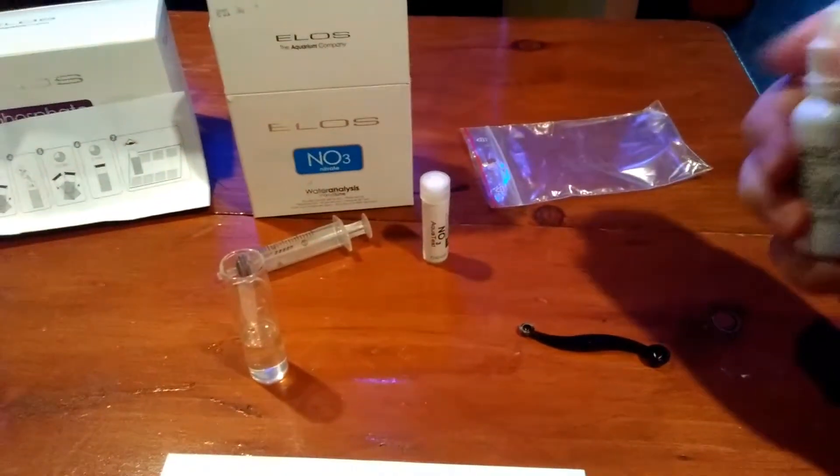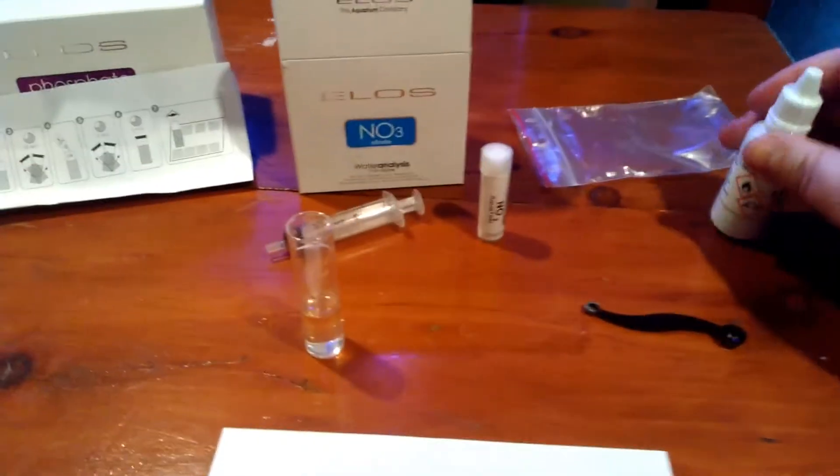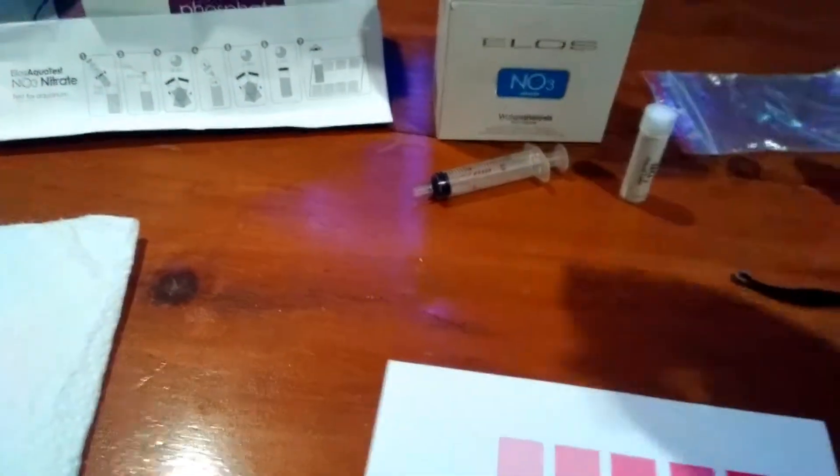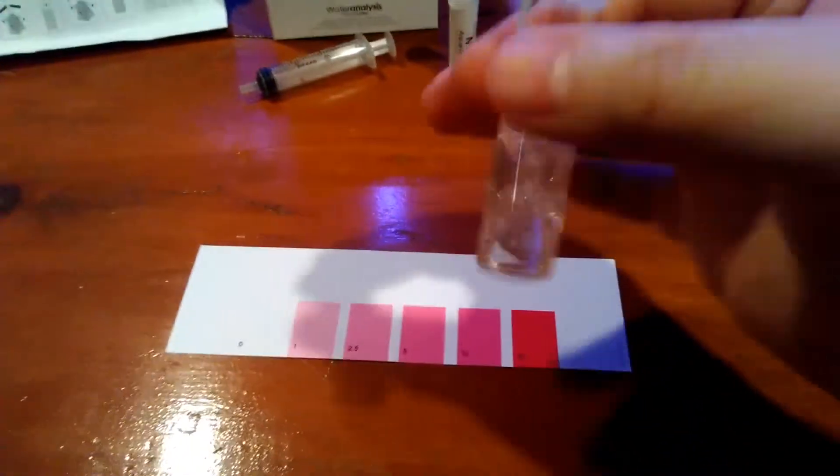Now mind you, I'm doing this all with one hand, so if you have trouble doing it with two hands, I'm sorry. Here we go. Put this on. Shake it up. 15 seconds.